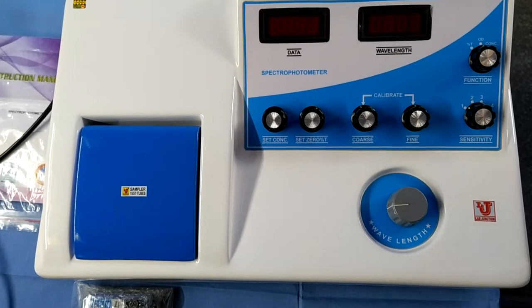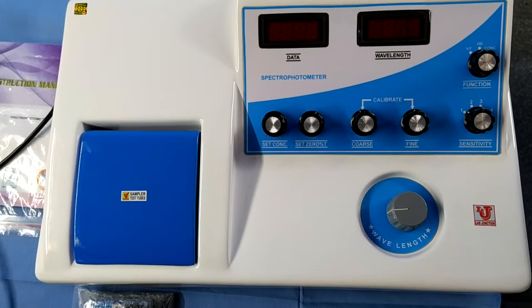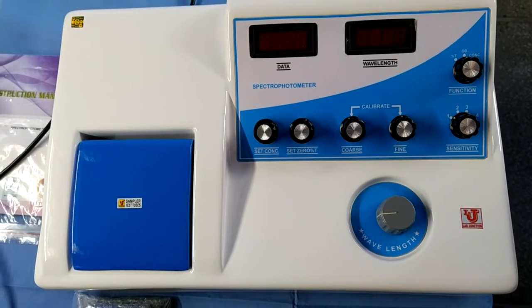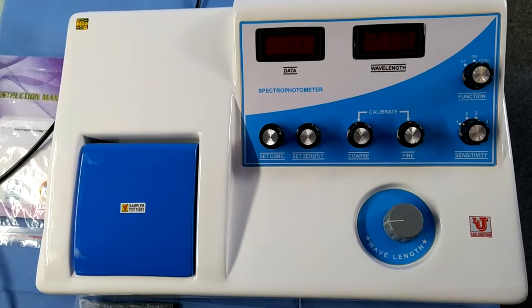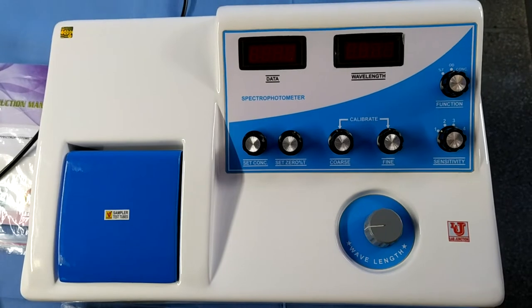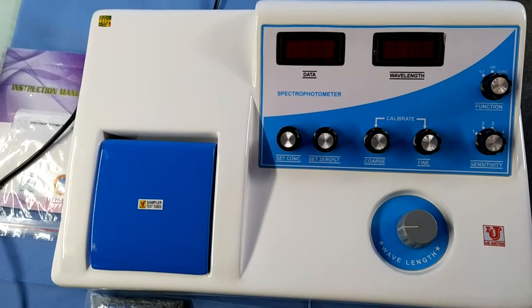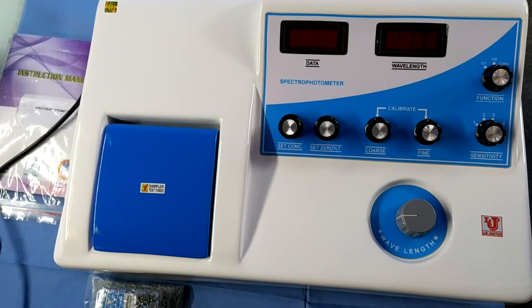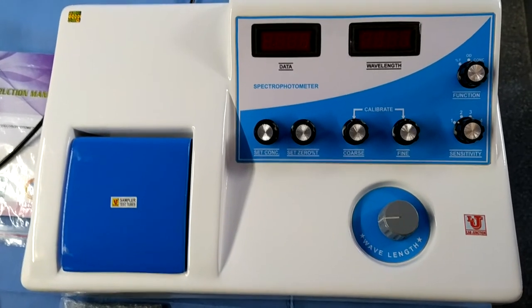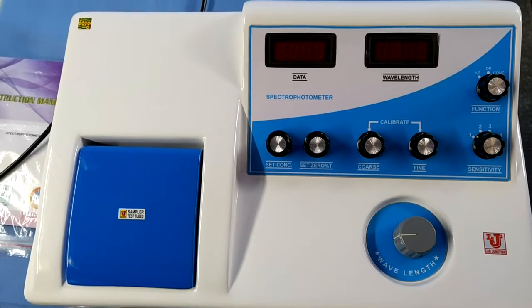Lab Junction's Digital Spectrophotometer. We have two models in visible spectrophotometer: LJ301 and LJ304. In LJ301 we supply 10mm glass cuvettes, and in LJ304 we supply 10mm glass cuvettes and 50mm glass cuvettes. In the LJ304 model, 10mm to 50mm glass cuvette placing facilities are available.